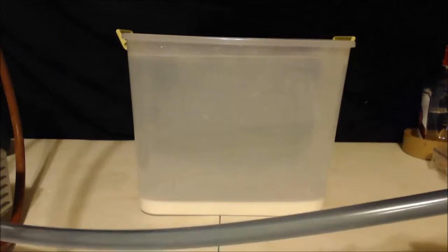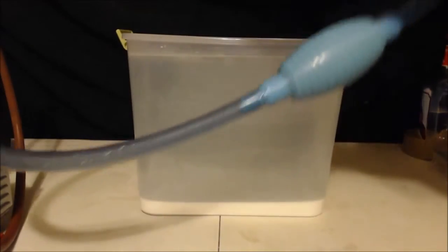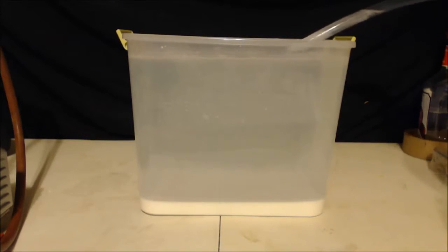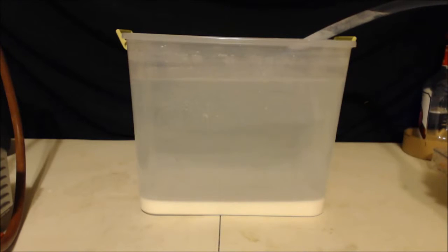And then I used this fish tank siphoner. See, it's got the little bubble thing on there. Now I'll show you how to do it. Put it in there and just siphon it out. Figure each time I do this, I'm getting like 90 percent of the water out. So that's getting rid of the byproducts that are soluble, like the sodium chloride, the potassium chloride.